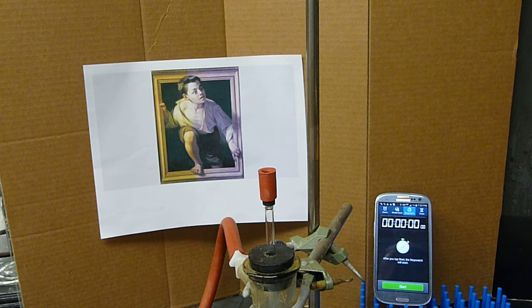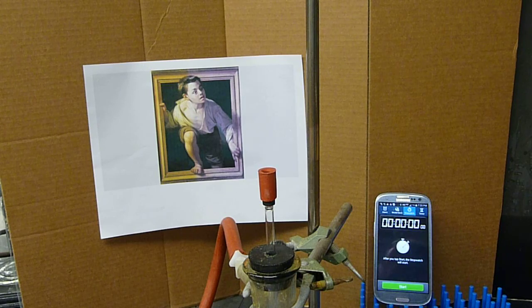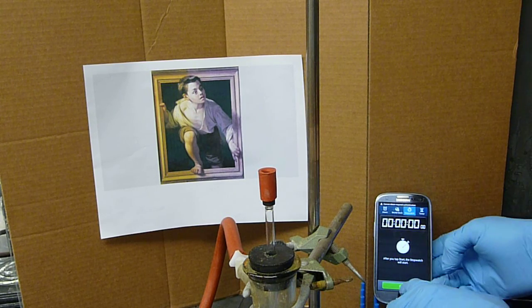This is a practical LC-MS quickie video. I'm going to start the timer.